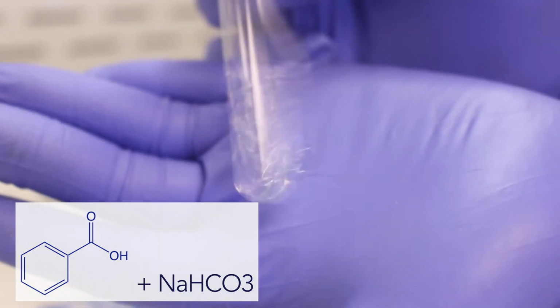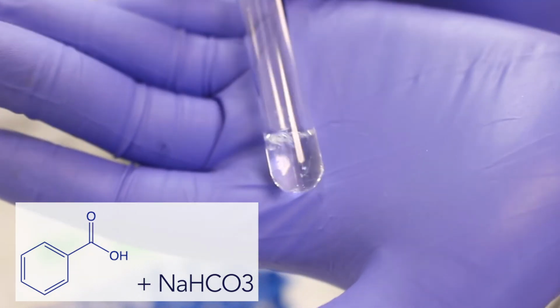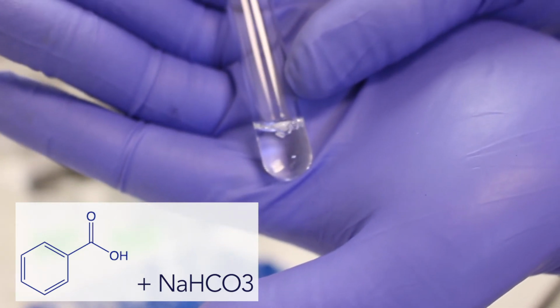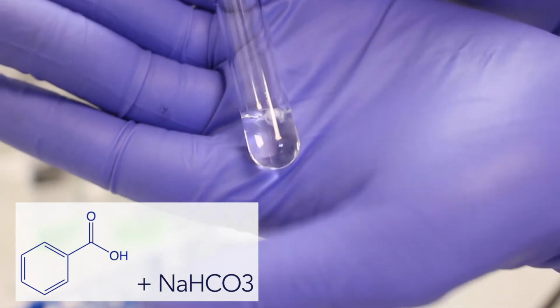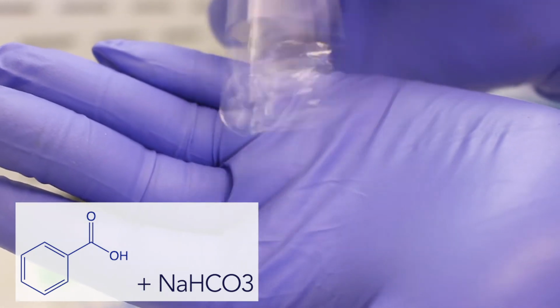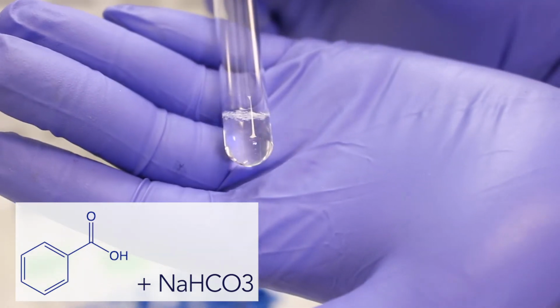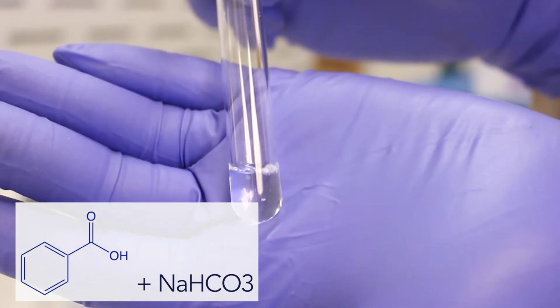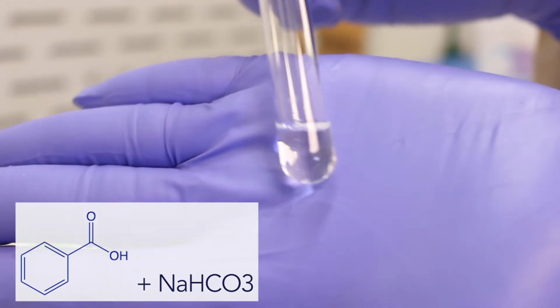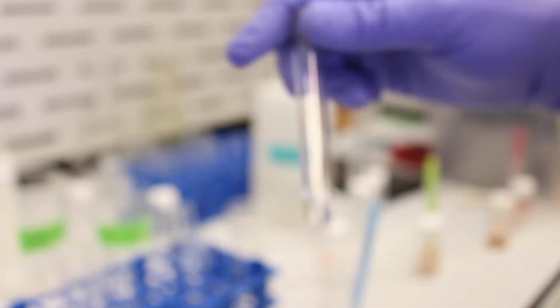So even though it's not going to fully dissolve, we can see that it is in fact dissolving because of the presence of some bubbles there. Those are CO2 bubbles coming out of solution. Given enough time, and perhaps if we heated it or crushed the benzoic acid before we added it, it would in fact dissolve. So benzoic acid and carboxylic acids tend to be soluble in sodium bicarbonate.